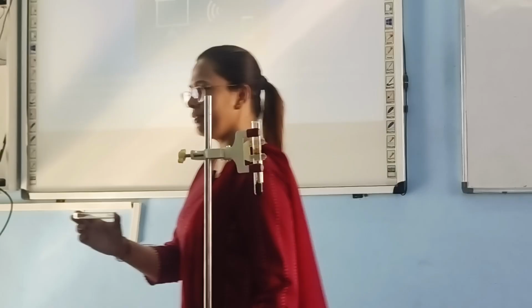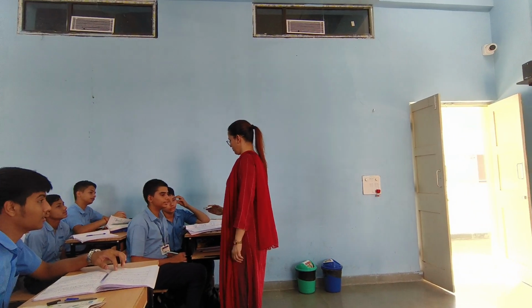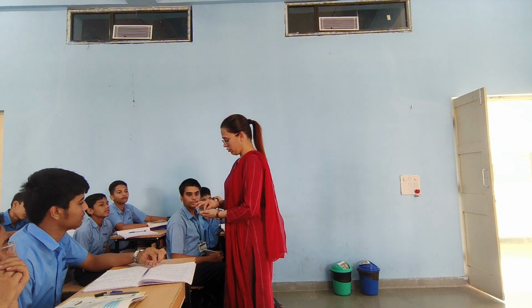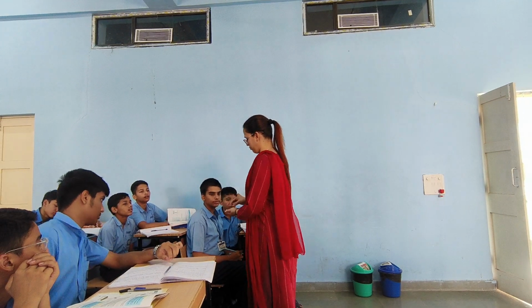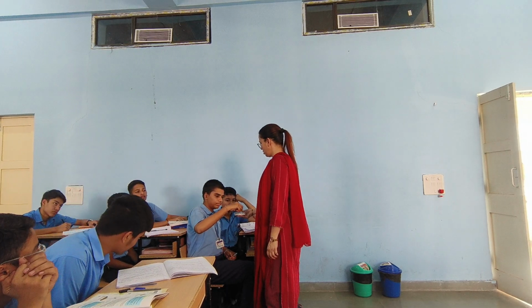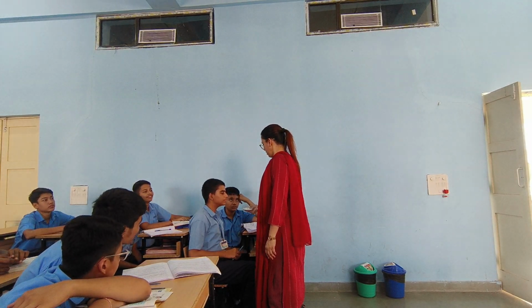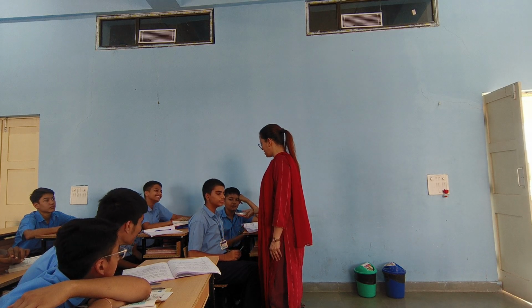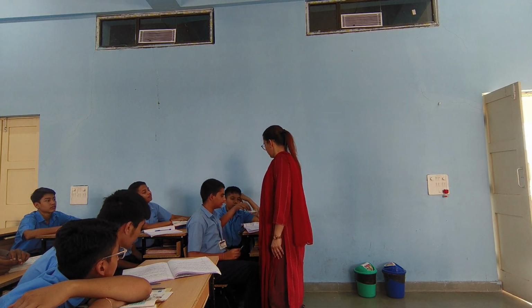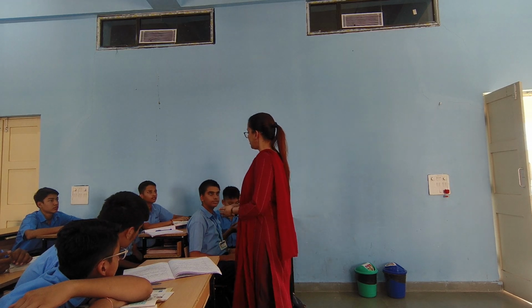What is the color of lead nitrate? What is its structure? Touch it, you'll get to know. Is it powder? Yes, ma'am. Is it not like crushed sugar? Salt, how is salt in reality?